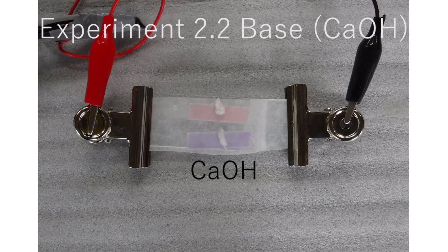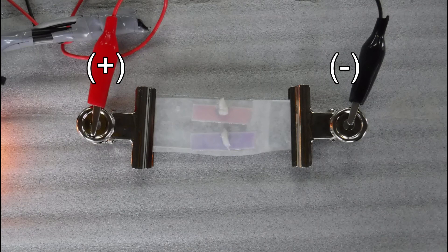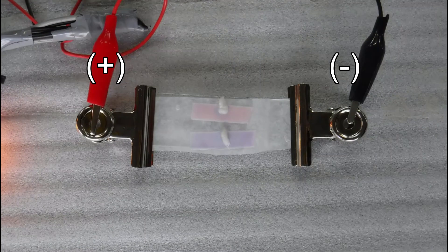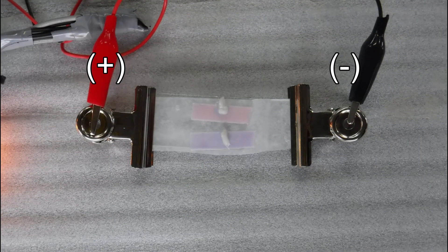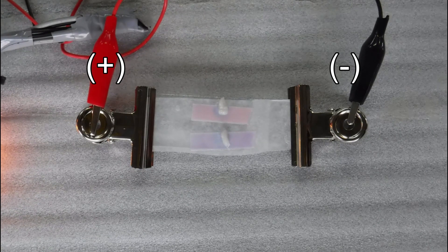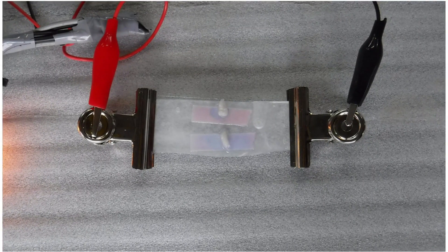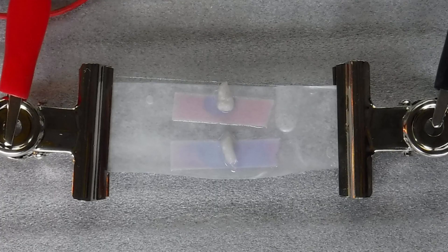Calcium hydroxide is applied again. The positive side of red litmus paper turned blue, but there was no color change at the negative electrode.